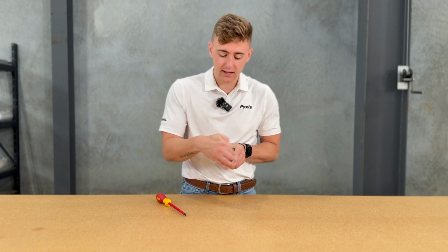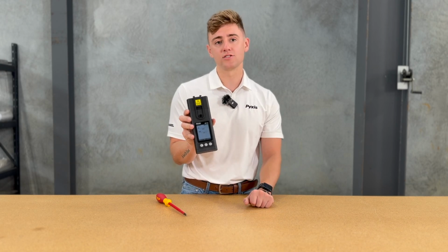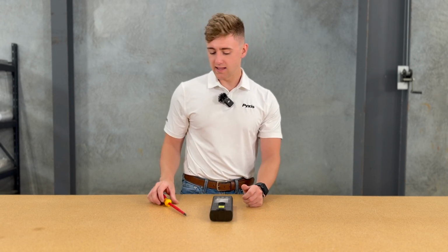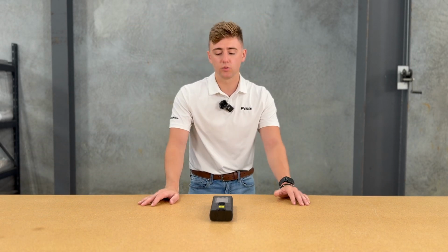And automatically, if I was already preemptively paired on the SP710, you can see that I'm already connected and reading for pH and ORP yet again. If you need to go through that connection process one more time, follow the steps that we just went through a little bit earlier. It's that simple to pair your pH ORP module and to exchange the battery within the module itself.